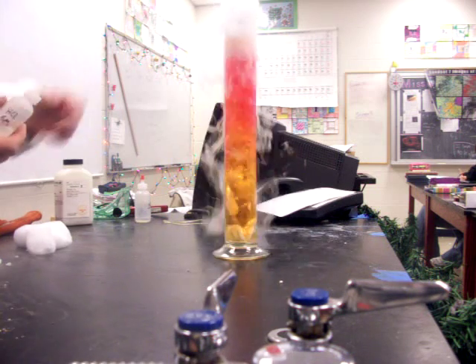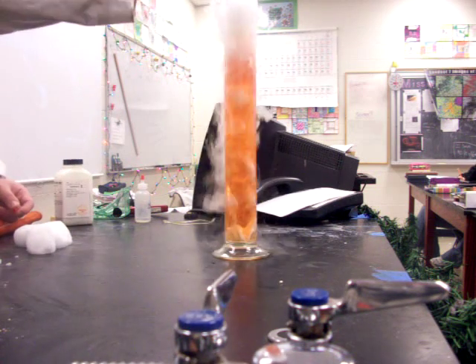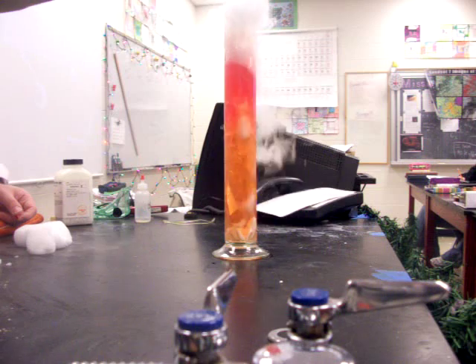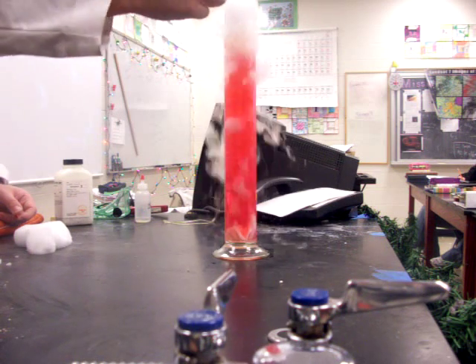Since I'm adding the acid to the top, you can see the color change going down there, but I've not added quite enough to get it into the true acid range.